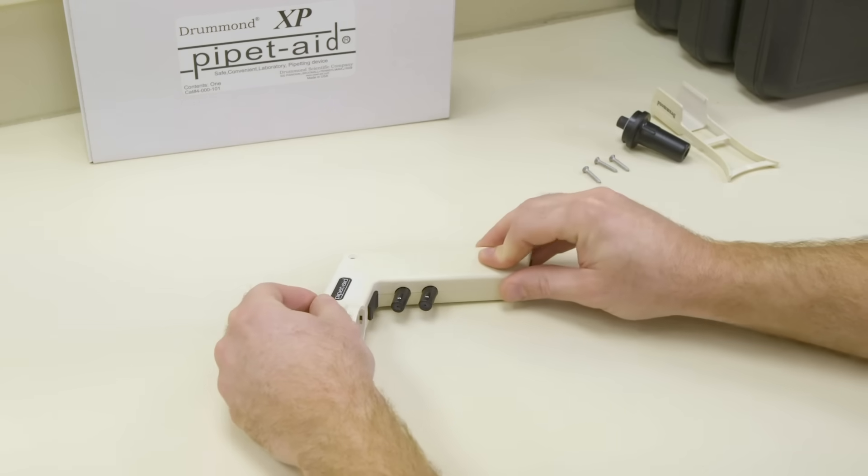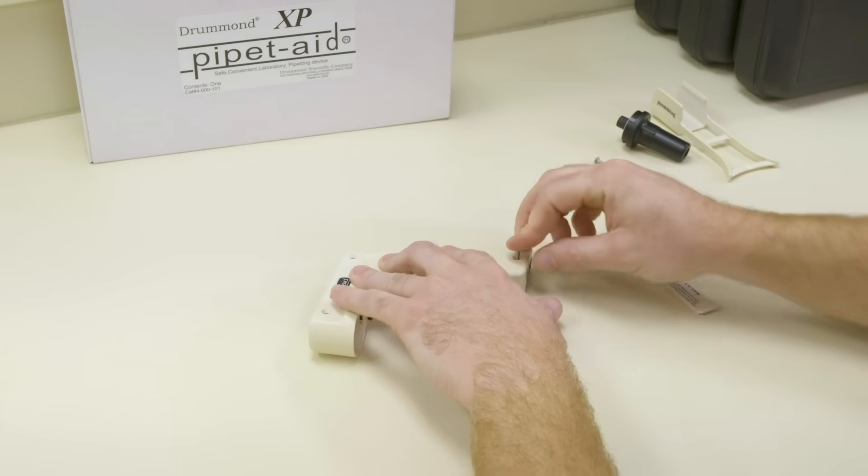Caution: do not crush or compress the O-rings when sliding the cover back into place. This can damage them.